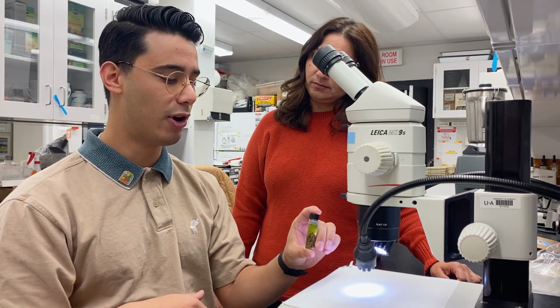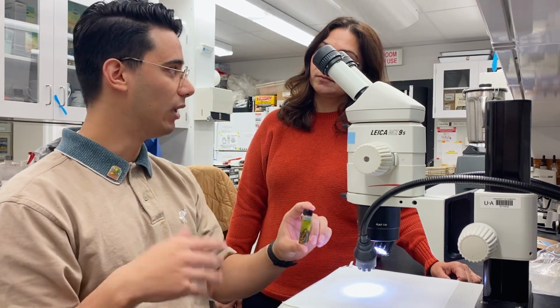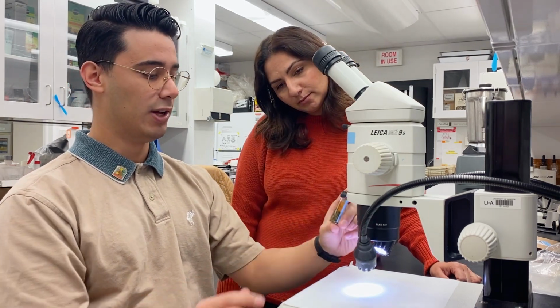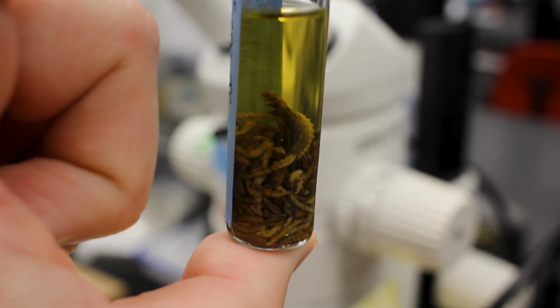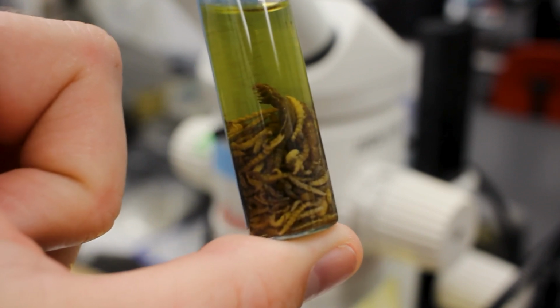And that'll help us get a better understanding for whether they're parasitoids, pollinators, natural enemies, or just general insect pests. So here I have a nice little vial filled with a bunch of larvae of Lepidopterans, so caterpillars. And so these will be looking to identify as well as part of our functional groups. Very interesting.